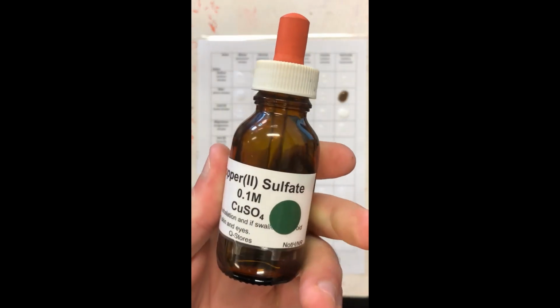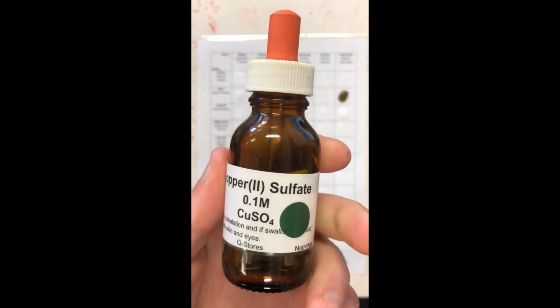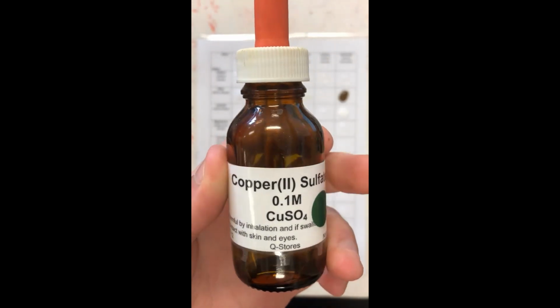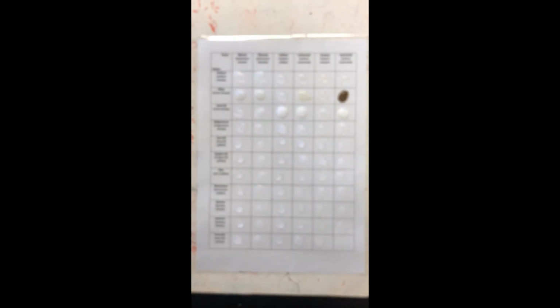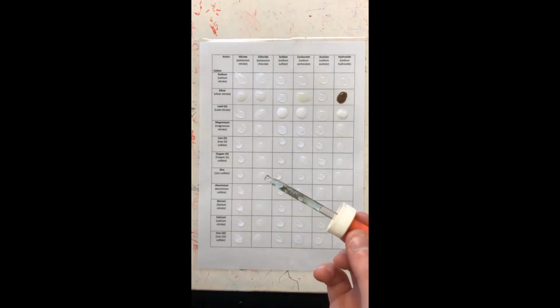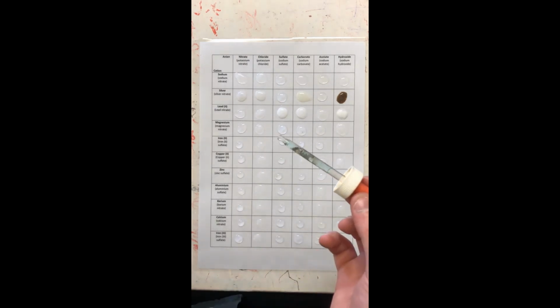This is going to make some extremely nice colors because copper salts are quite colorful. We already knew that in our corrosion prac, right? Because we've clearly seen that we get a nice verdigris, which is what turns the Lady Liberty in New York. But we'll do this now.